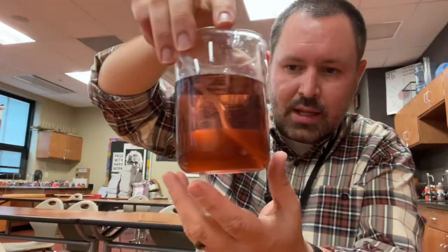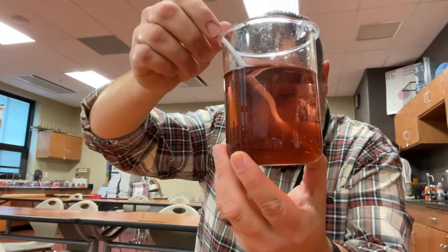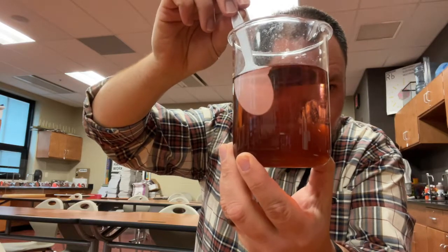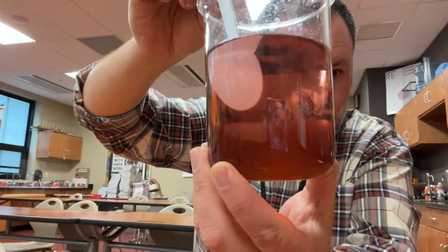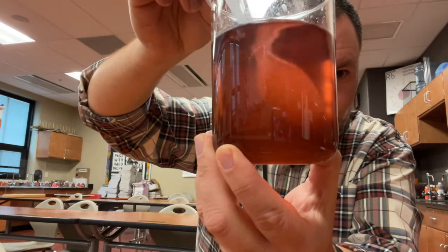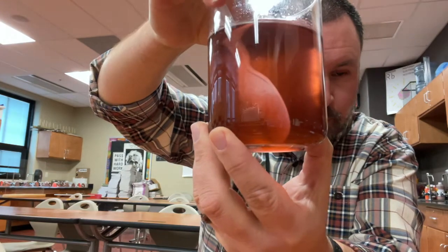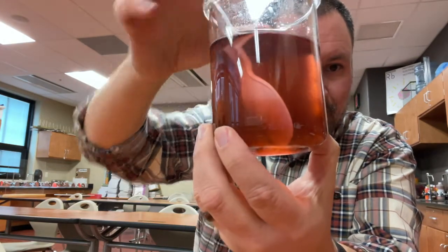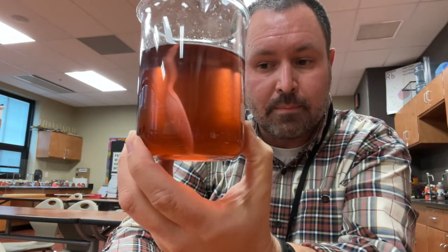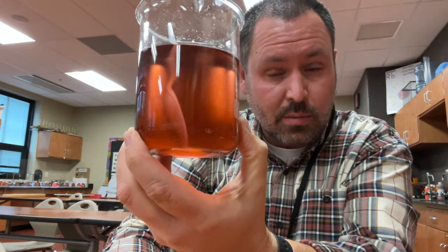Next we have the gelatin. This gelatin has not been stirred for a while, and notice what happens when I do stir this. So let's give this a little bit of a whirl. So what's going on here with this gelatin? One thing that I should say is that if we were to cool it, it would turn into a solid, of course, like Jello, semi-solid.